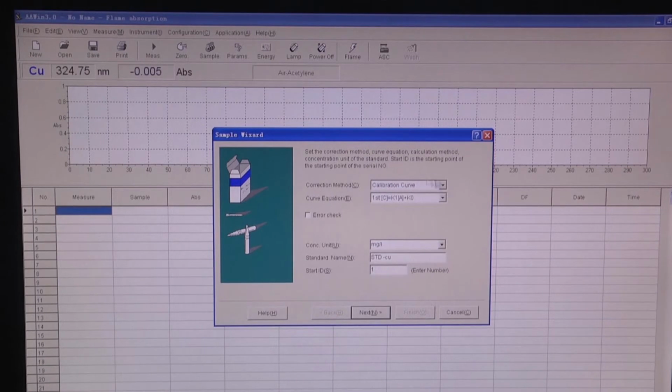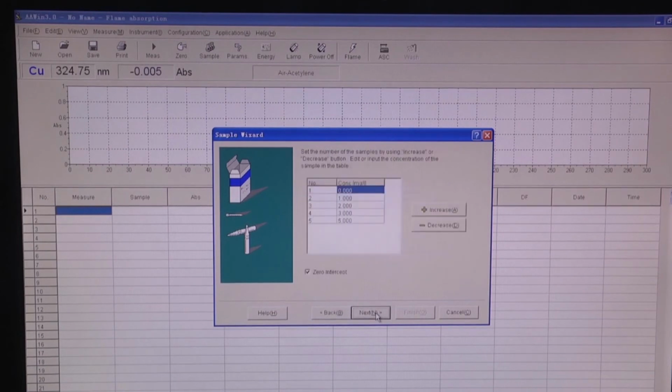In this interface, we have correction method, curve equation, concentration unit, standard name, and start ID. For flame analysis, we always use calibration curve. If we have samples with a high concentration, we normally use the second or third equation. But most of the time, we choose the first equation of concentration about absorbance. For the concentration unit, you can choose as you like. And here input the standard names and start ID. All finished, we press Next.